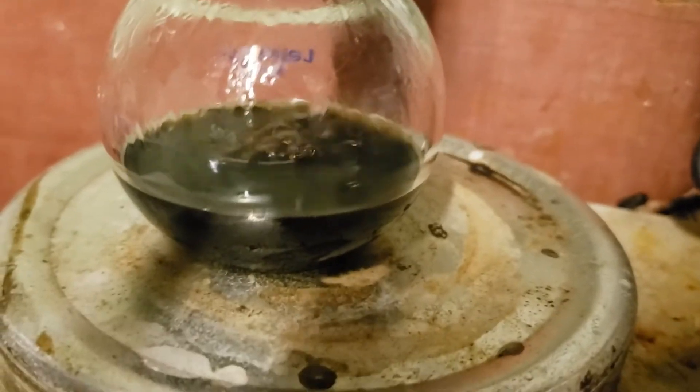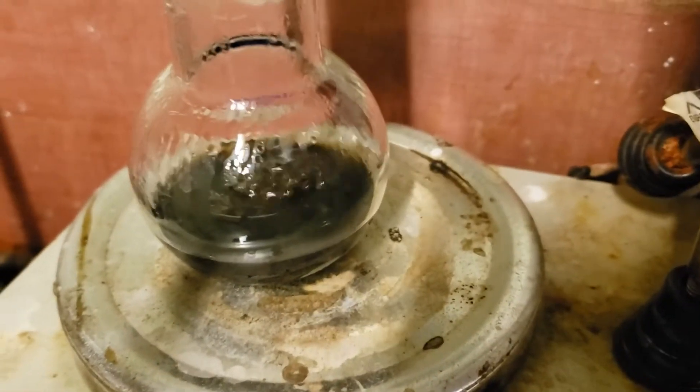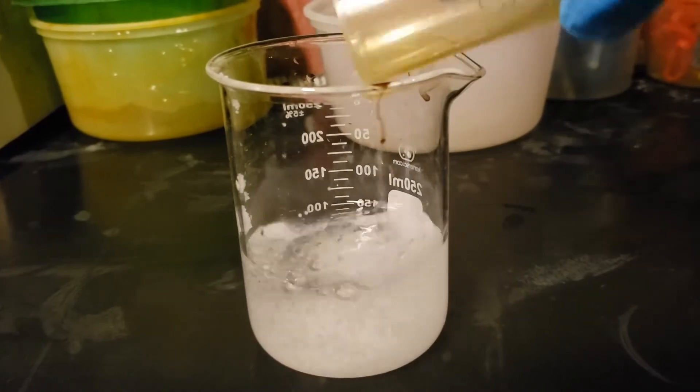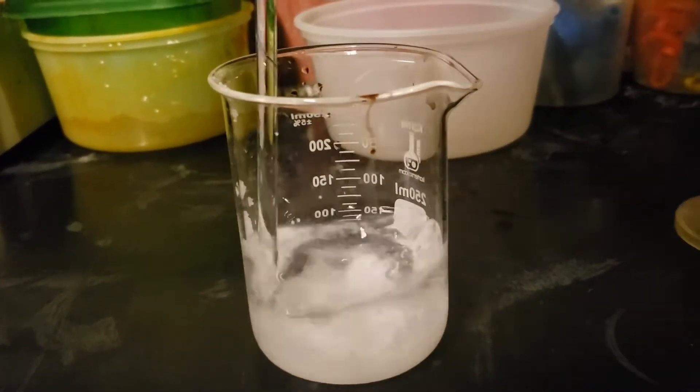In this video, we will be synthesizing benzimidazole, an aromatic compound that forms nice crystals from orthophenylenediamine and formic acid in a simple condensation reaction.